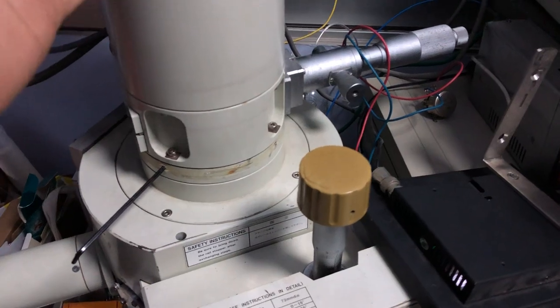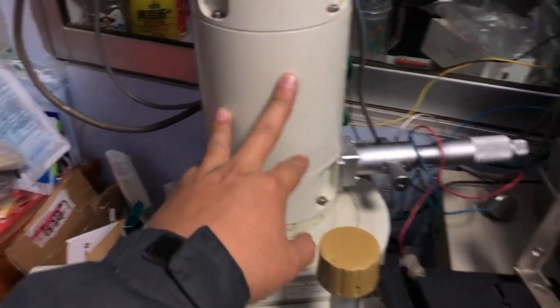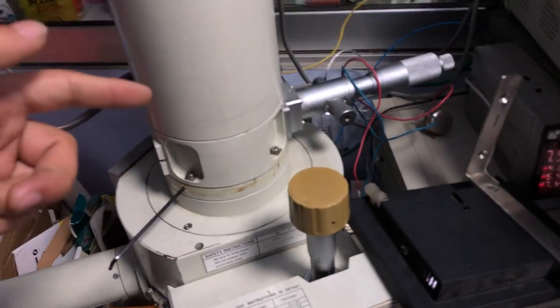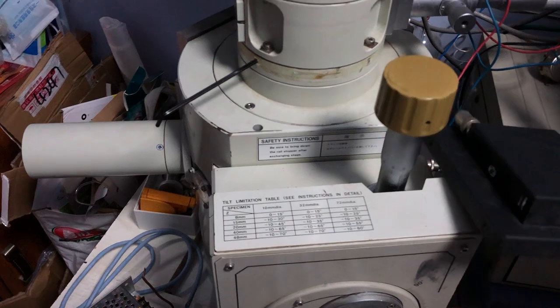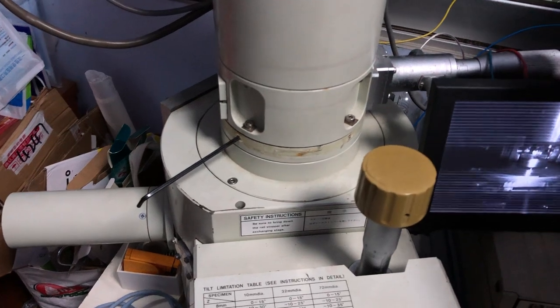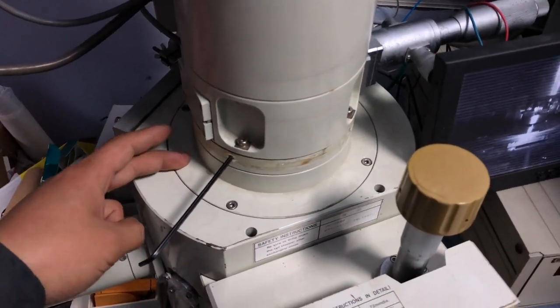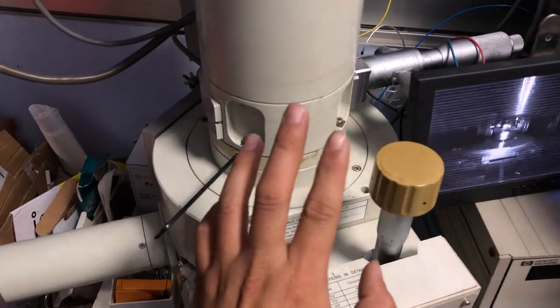Because I've been taking it apart before to find out what this cable does, when I put it back and reassembled it, I did not get quite the accuracy between this column and the scan coil and the objective coil. So there's a little bit of twist between these two structures.